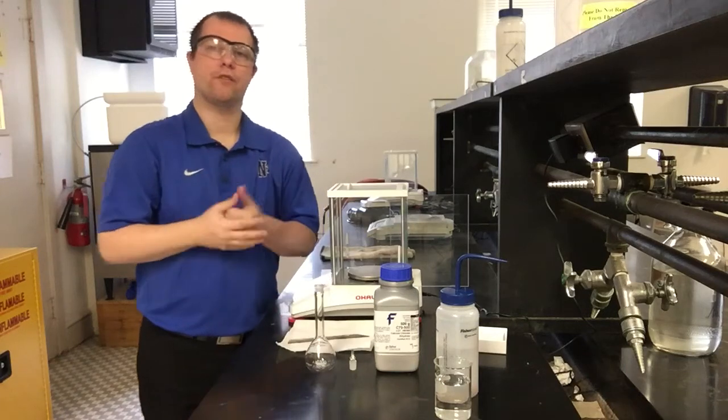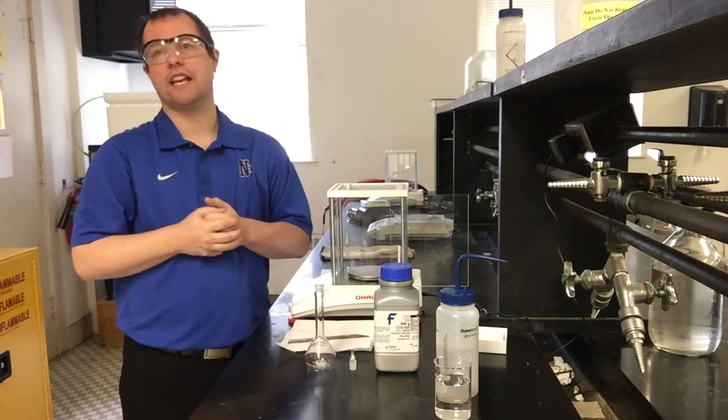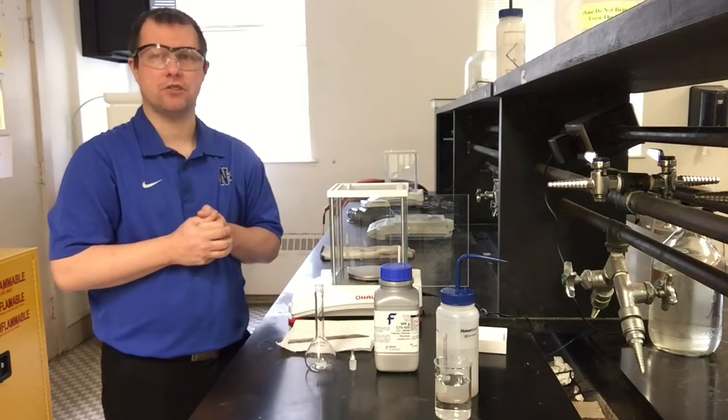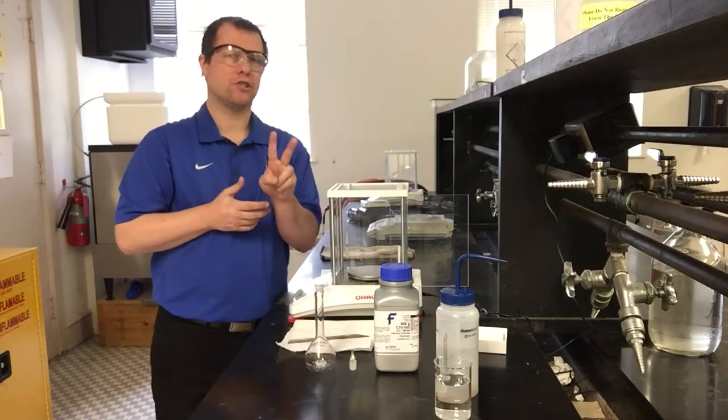All right, welcome to another week of our online 1211 lab here in North Georgia. I'm Dr. Meyer, and this week what we're going to be taking a look at is our solutions lab. So we're going to be making a couple different solutions, and then we're actually going to use those solutions to do a precipitation reaction. And so we'll have kind of three main parts to this experiment, because we're going to make solutions two different ways.